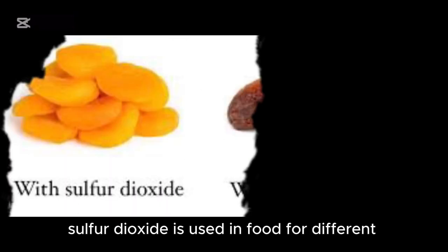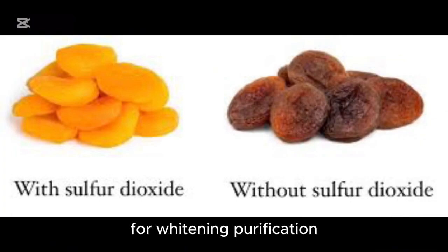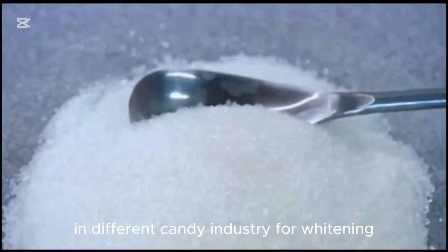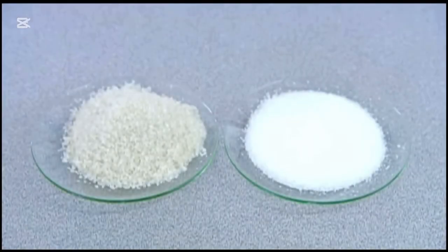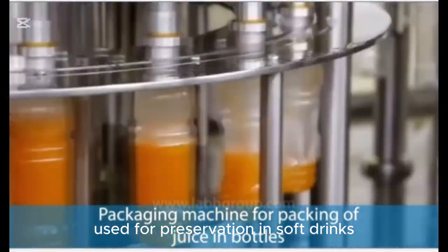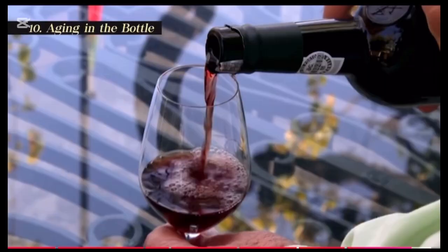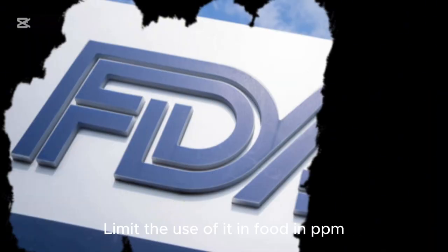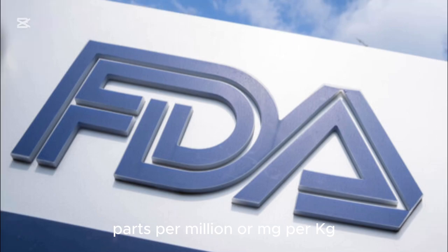Sulfur dioxide is used in food for different purposes: for whitening and purification, for example in the sugar industry and candy industry. It is also used for preservation in soft drinks and wine for long shelf life. The FDA limits its use in food in ppm — parts per million — or mg per kg.